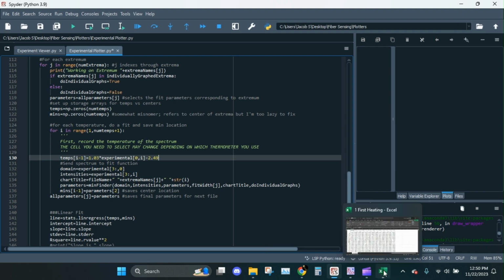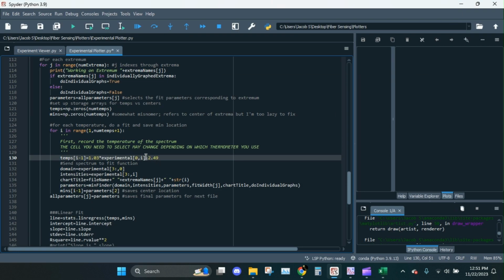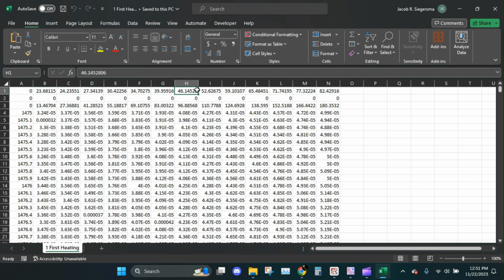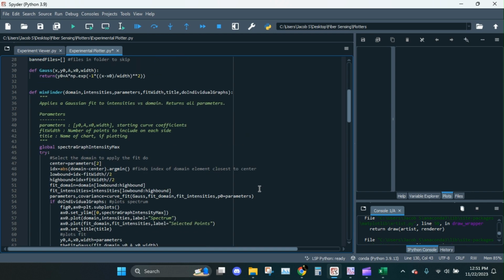Right? But here's the crux, right? If you used the other temperature sensor, it could be down in the second row instead. So we need to point this to different places. So basically, all you would need to change is here, where it says experimental of 0i. What that currently means is, okay, we're going to go to the experimental array. We're going to go to the 0th row, right? It's 0 indexed, and the ith column, right? So 0th row, ith column. And you can see it's grabbing the temperatures. If the temperatures were instead saved down here, this is row 1. So we would need to change that to a 1. And the reason it's being changed by this linear factor is that I found the thermometer wasn't quite calibrated to boiling melting points, so that's just a correction. That's the big one.